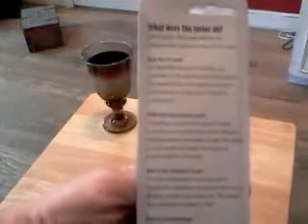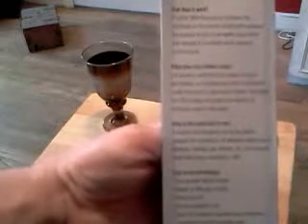With the push of a button, the electrodes in the bottom of the tester measure the amount of ions in the water and convert that amount to a number which displays on the screen. The number means the amount of parts per million, or milligrams per liter, of dissolved solids that exist in your water sample.